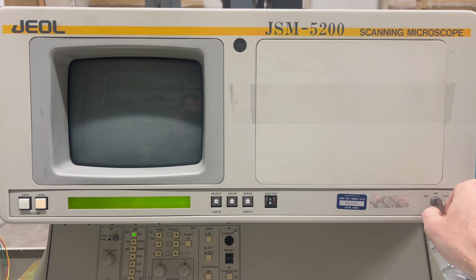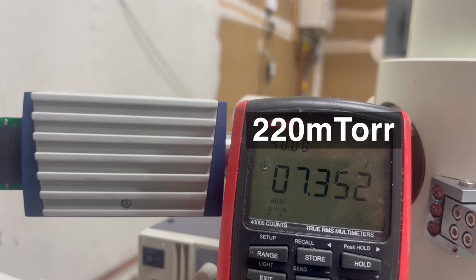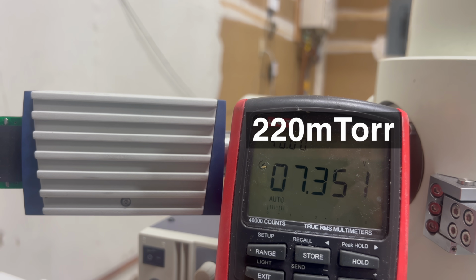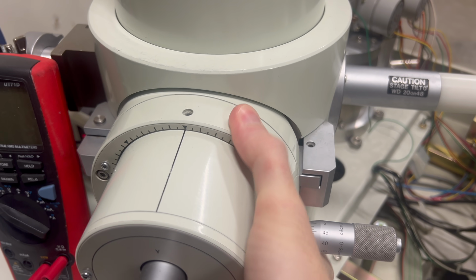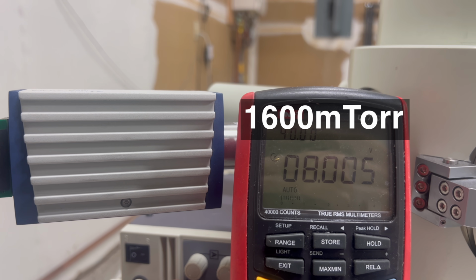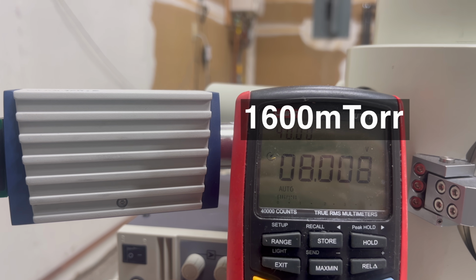I fired the machine back up and darn, still leaking. That's unfortunate. I wonder where the leak is. I spent quite a while inspecting various parts on the machine, using the valves to isolate different segments, and then watching as the pressure slowly climbed. However, nothing seemed like it was actually leaking.